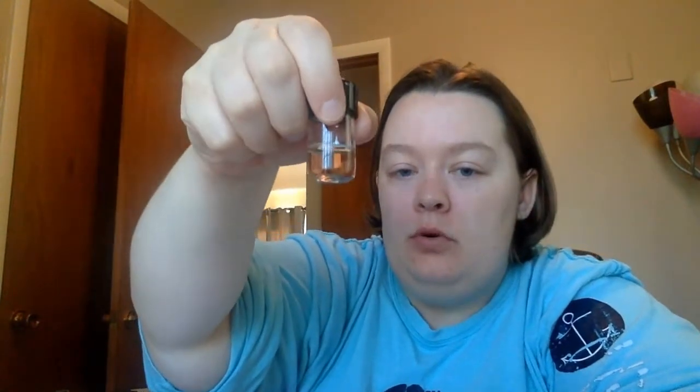The last question in our lab from last time asked, what other properties do we know about rafinotoxin that we could use to help isolate it from our sample? Here's our sample that we're going to work with, and this is what we got from part 1 of our experiment. One other piece of information that we had from our part 1 scenario, if you want to pull that back out, is that another thing we know about rafinotoxin, other than its size, is that its isoelectric point is 7.